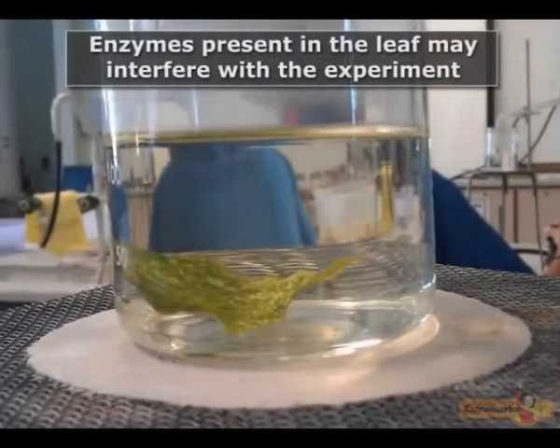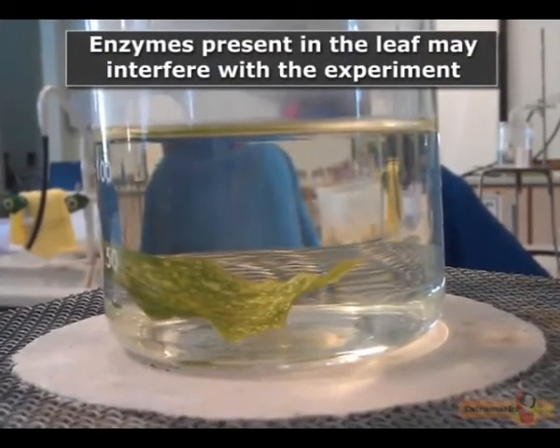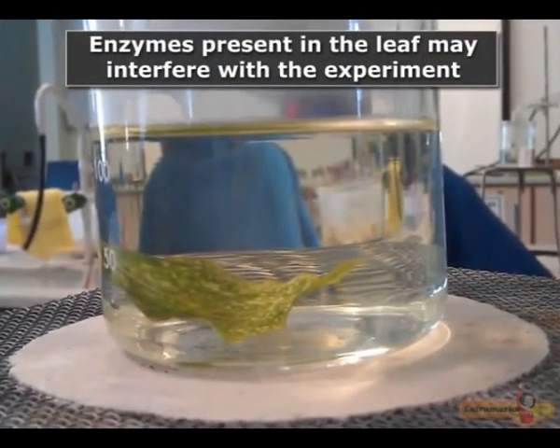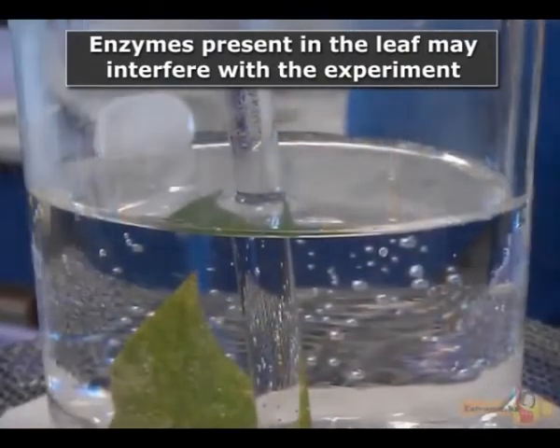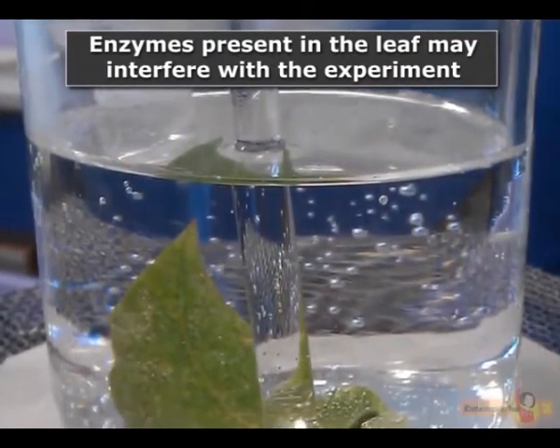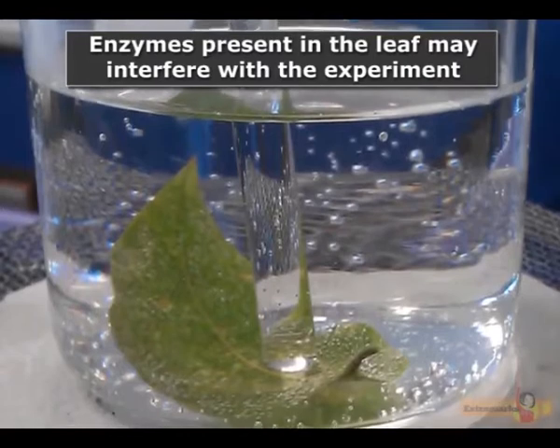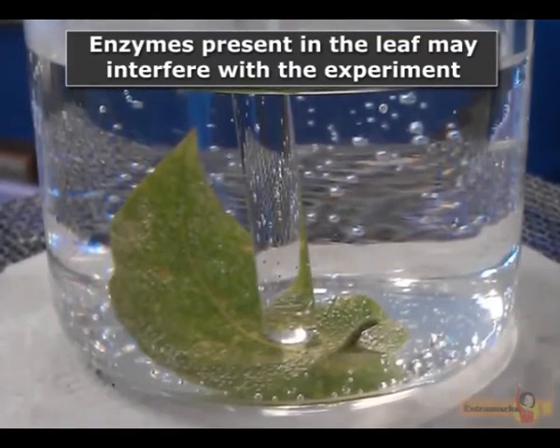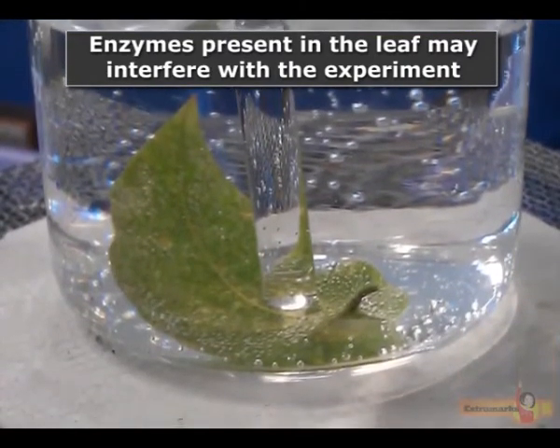The detached leaf from the plant is dipped in boiling water for 30 seconds. Boiling the leaf in water destroys the enzymes, thus preventing all further chemical changes during the experiment.